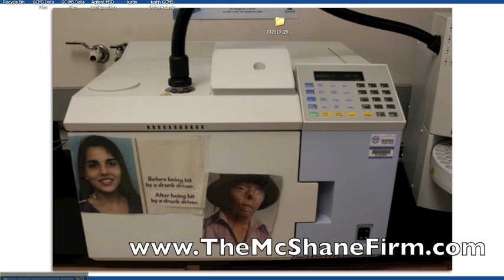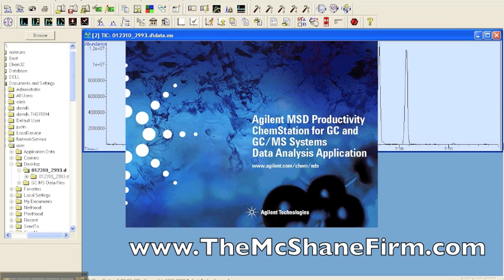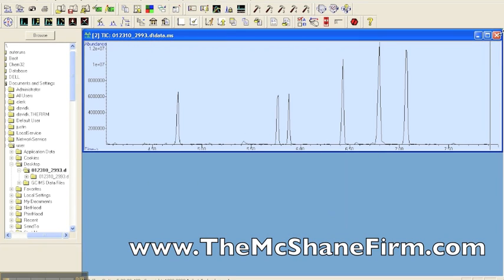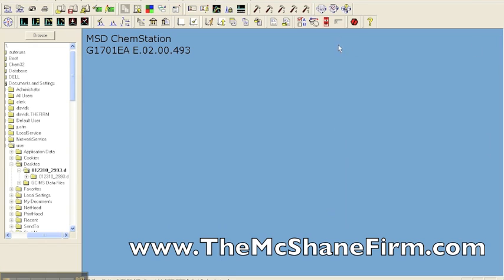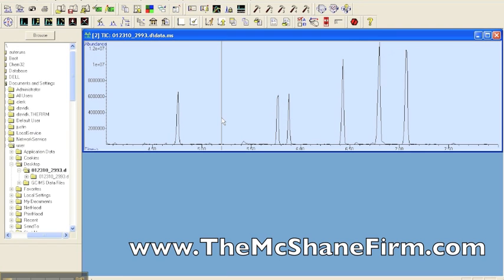So the first thing that we're going to do is double-click on the ChemStation software startup here, and as you'll see on the splash screen, it's the most recent version of the system software itself, and here are the prompts that go along with it. So what we're going to do is load in some data from an analysis of a case that's here.